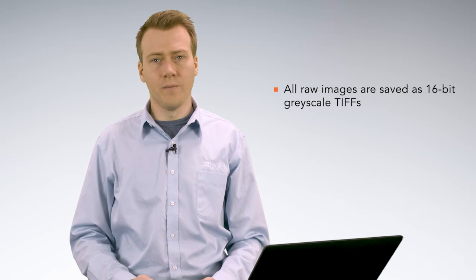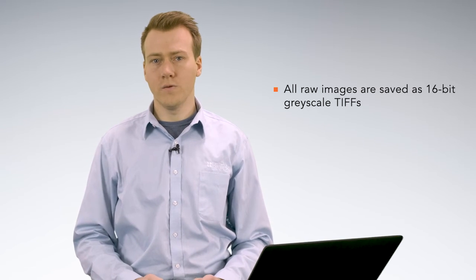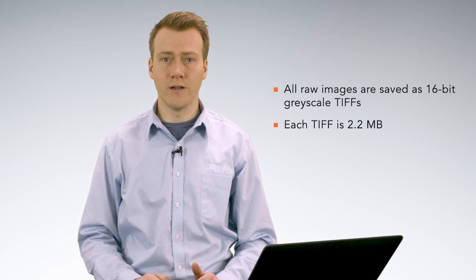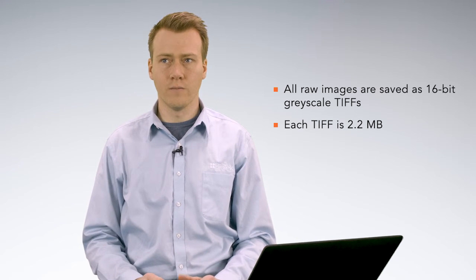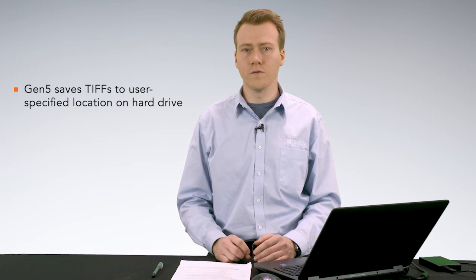All images taken by BioTek imagers are saved as 16-bit grayscale TIFFs. Each one of these TIFF files is 2.2 megabytes, which, as you can imagine, adds up pretty quickly in experiments involving microplates where often 3 or more images are taken per well. Gen5 saves the raw TIFF files to a user-specified folder on the hard drive.